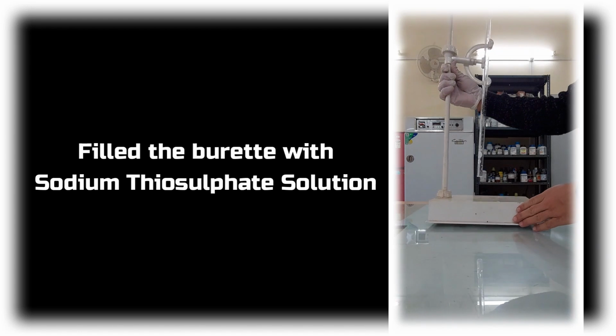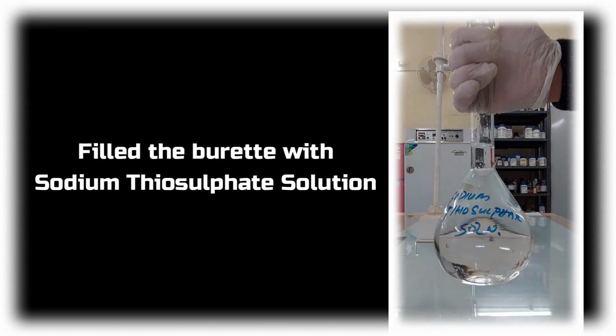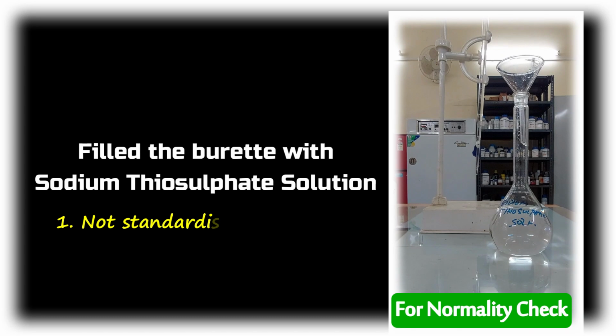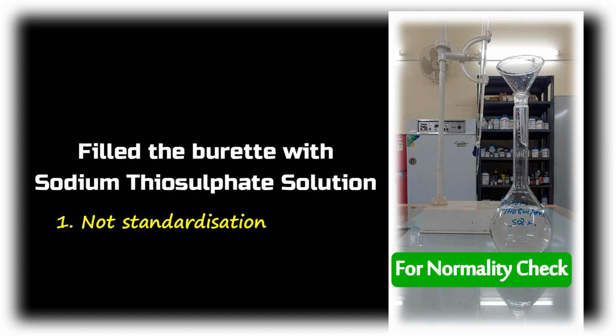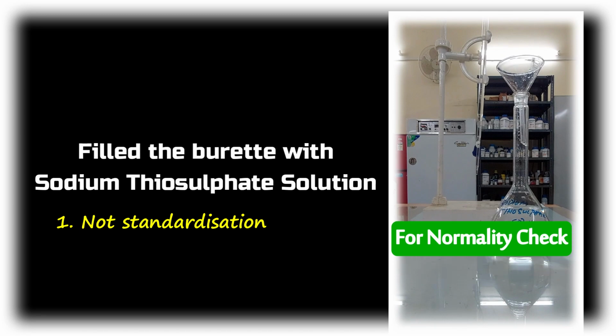Next, fill the burette with the sodium thiosulfate solution. There are two possibilities when it comes to the sodium thiosulfate solution. Number one is when the sodium thiosulfate solution is prepared and used directly for titration, then the normality of the prepared sodium thiosulfate solution can be taken as 0.025 normality.